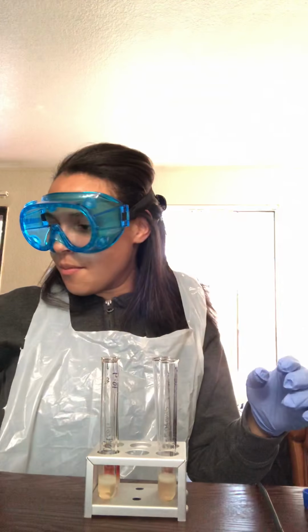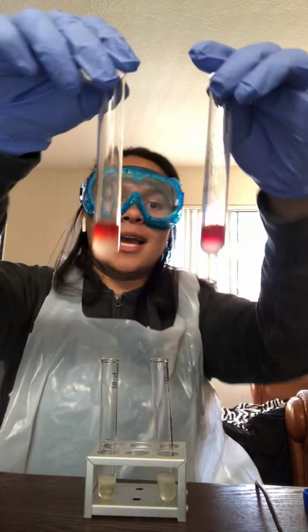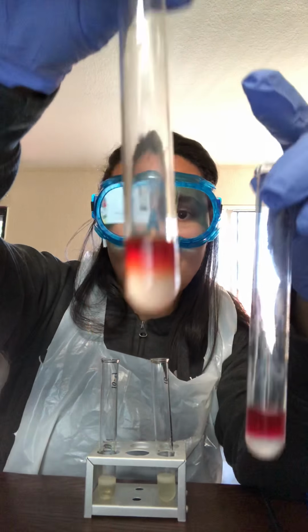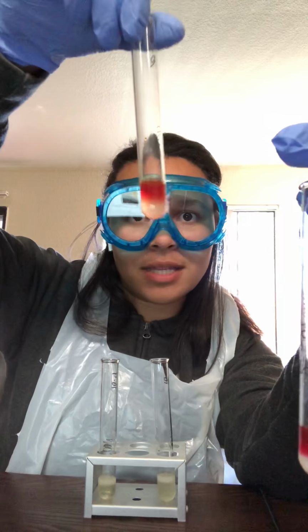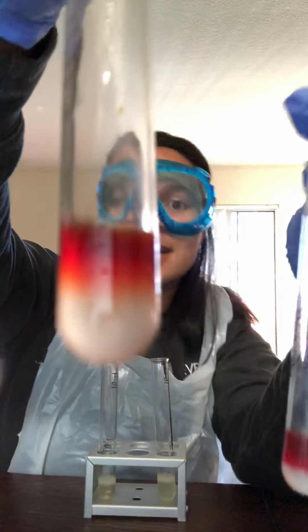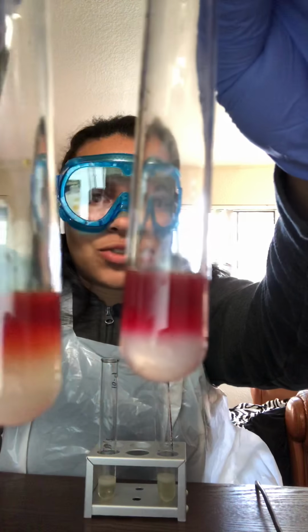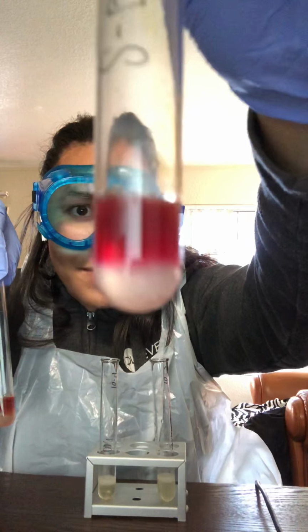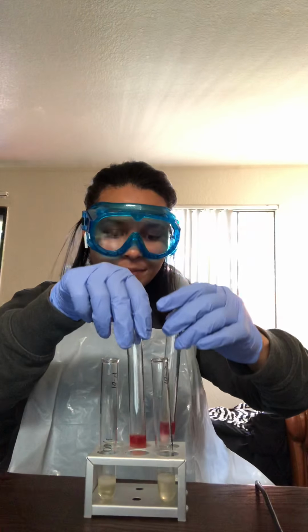Now, for the methyl red, the E. coli, interesting. The E. coli shows an orange layer at the top with the clear bottom of, I'm assuming, the E. coli, and it has little specks of particles at the very top here. That's more of an orange color compared to this pinkish red, which is the S. epidermidis. It has the clear at the bottom and then the pink at the top with the little small particles that are floating. So that pretty much concludes my result for this experiment.